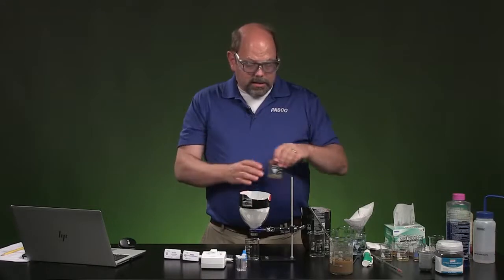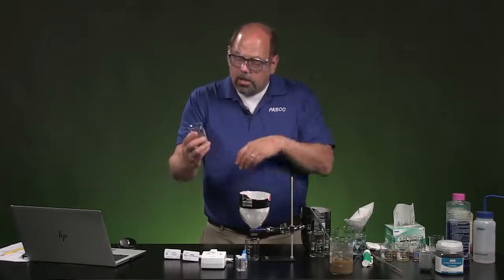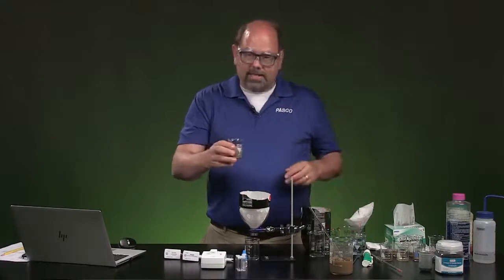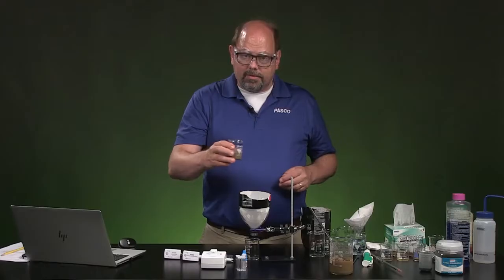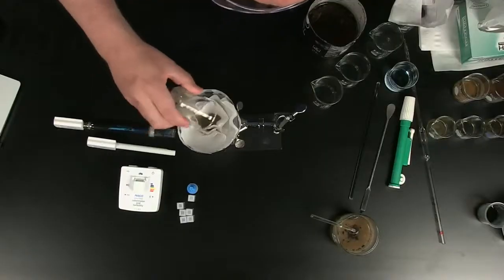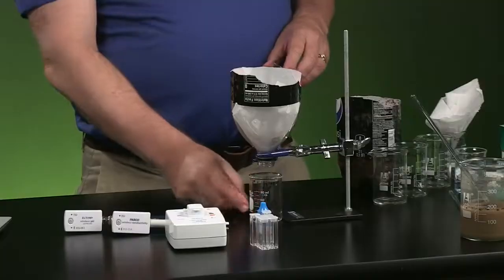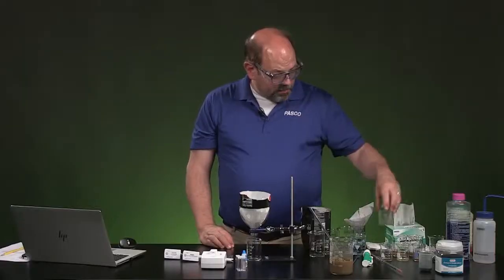All right. Not that I'm gathering data, but I'm going to show you the process. Here's our untreated water, just stirred, so there wasn't any time to allow this sediment to sink down. You're just going to pour that into your filter like this, and allow that to come through and drain into the bottom cup.